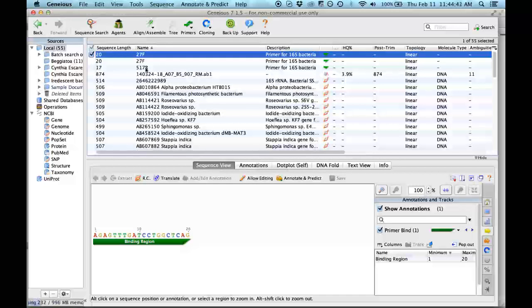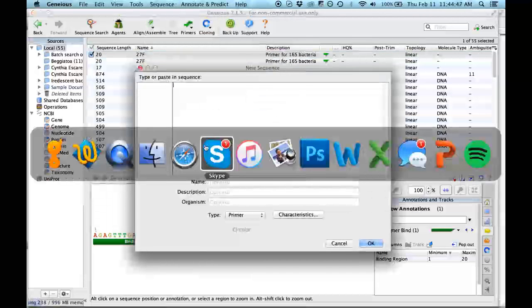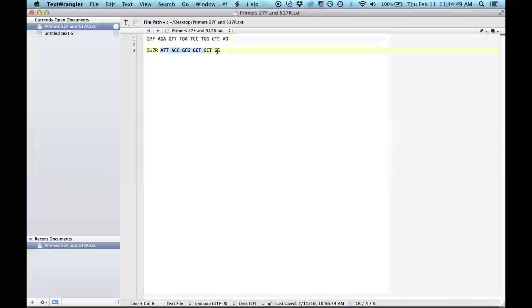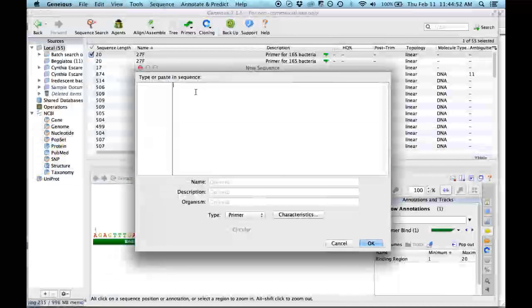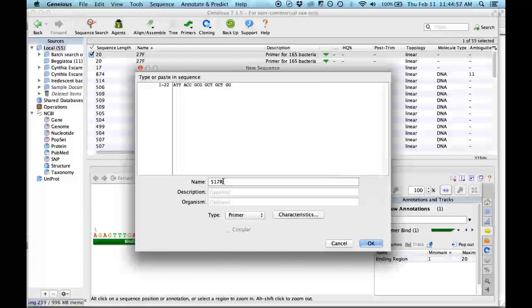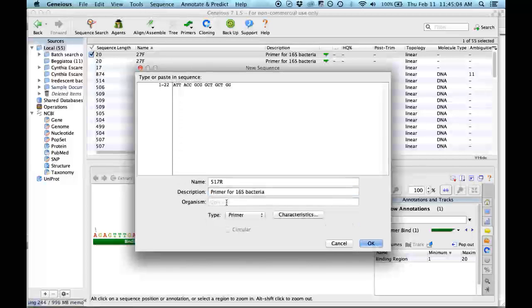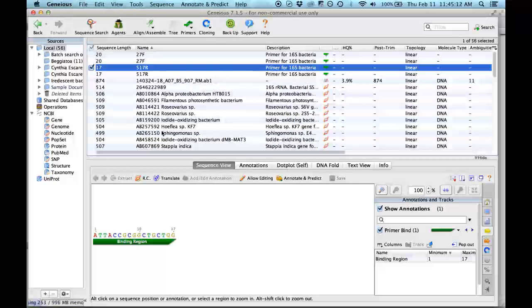There I have the other one. Now we will incorporate the other one. We will go to this one and copy this. This appears because I already wrote it, but the first time that you do it, you have to write it by yourself. It's a primer for bacteria, the same here and the same here. And it's really important to put primer there. So we are done with the primers. Now the primers that you used for your PCR are incorporated in Geneious.